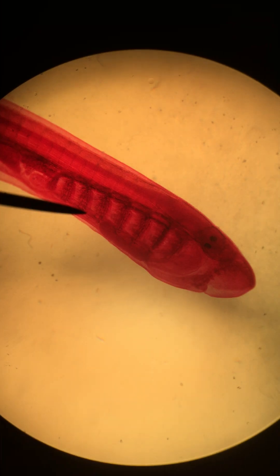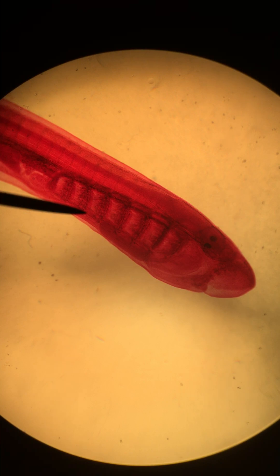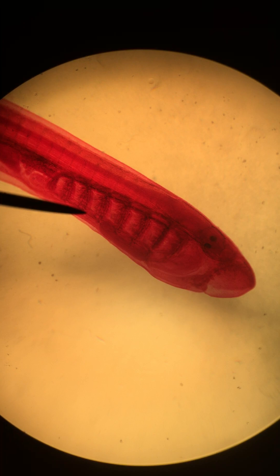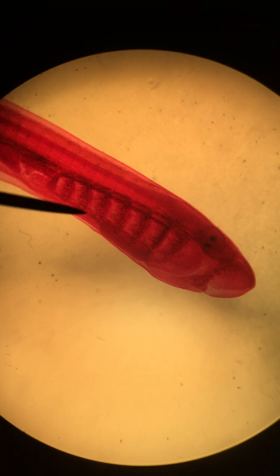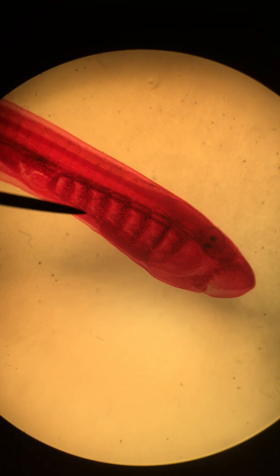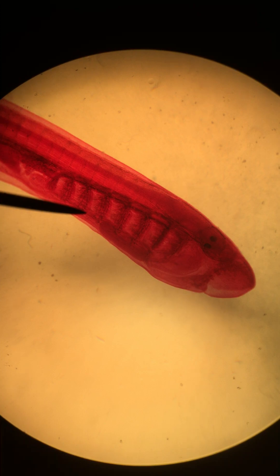Hi, GenBio. Dr. Fry here with the Ammocoetes whole mount, which is the larval form of our lamprey. The lamprey is a chordate, and so it has the four characteristics of chordates, which you should look for when we look at this slide.